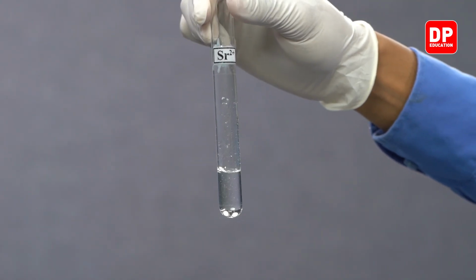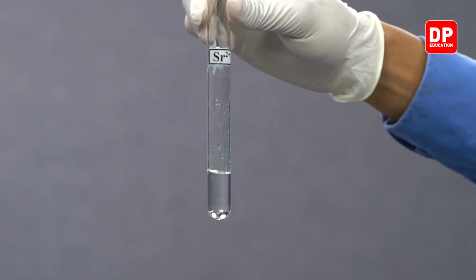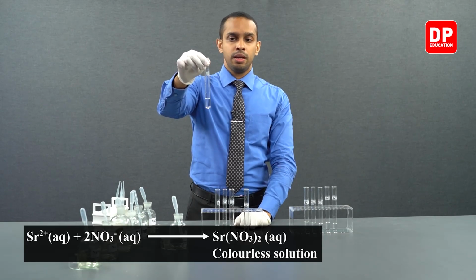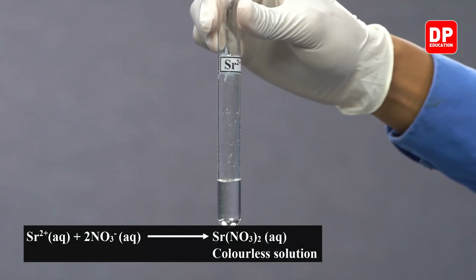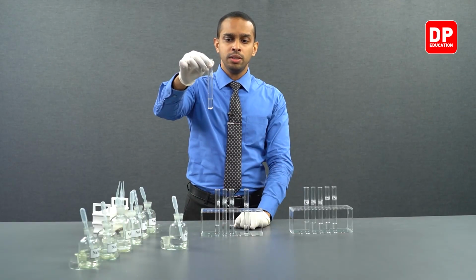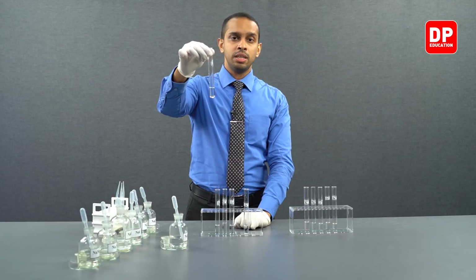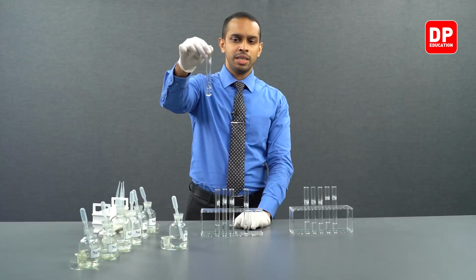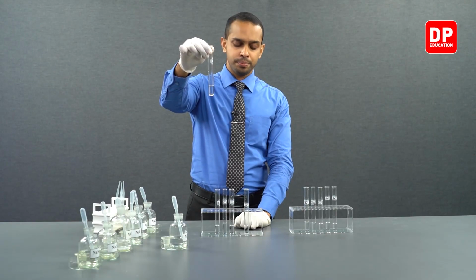Now you can see when strontium 2 plus aqueous ion solutions come into contact with nitrate ions, they form strontium nitrate. Strontium nitrate is also very soluble in water, so therefore you will not see the formation of a precipitate here as well. You can see the solution is clear.